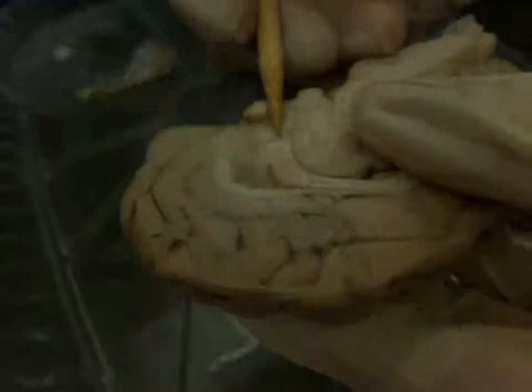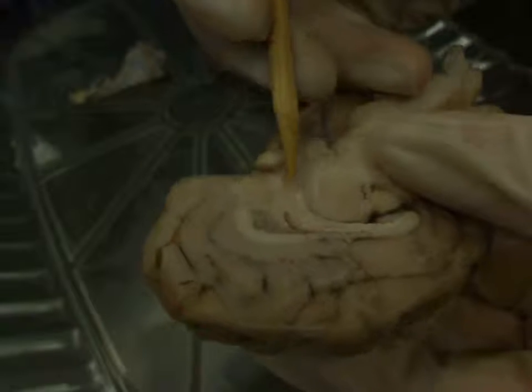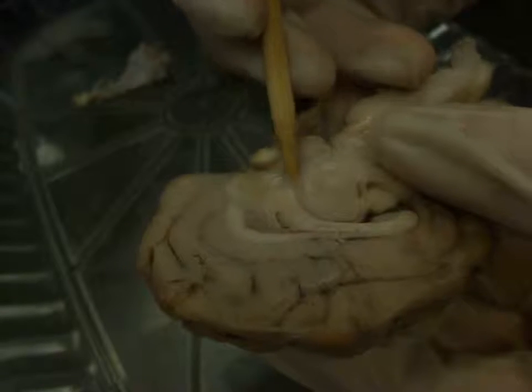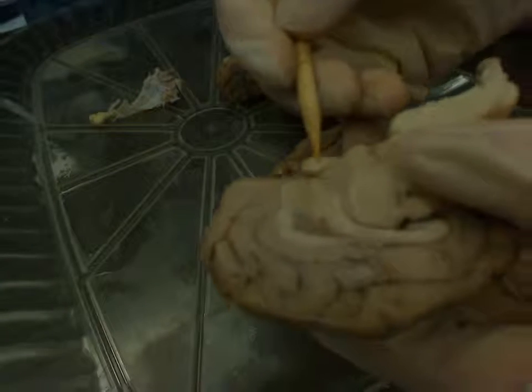It's probably going to be hard to make out on the cam, but if you're following the fornix down, the place where it starts to wrap around the thalamus this way, the anterior commissure is going to be in there, so you're going to look for a little white dot just as the fornix kind of reaches the apex of its arch. Okay, so in here is a little white dot, anterior commissure. The bottom structure. Okay. The bottom structure is what? The other white matter tract we can see here is the optic chiasm.